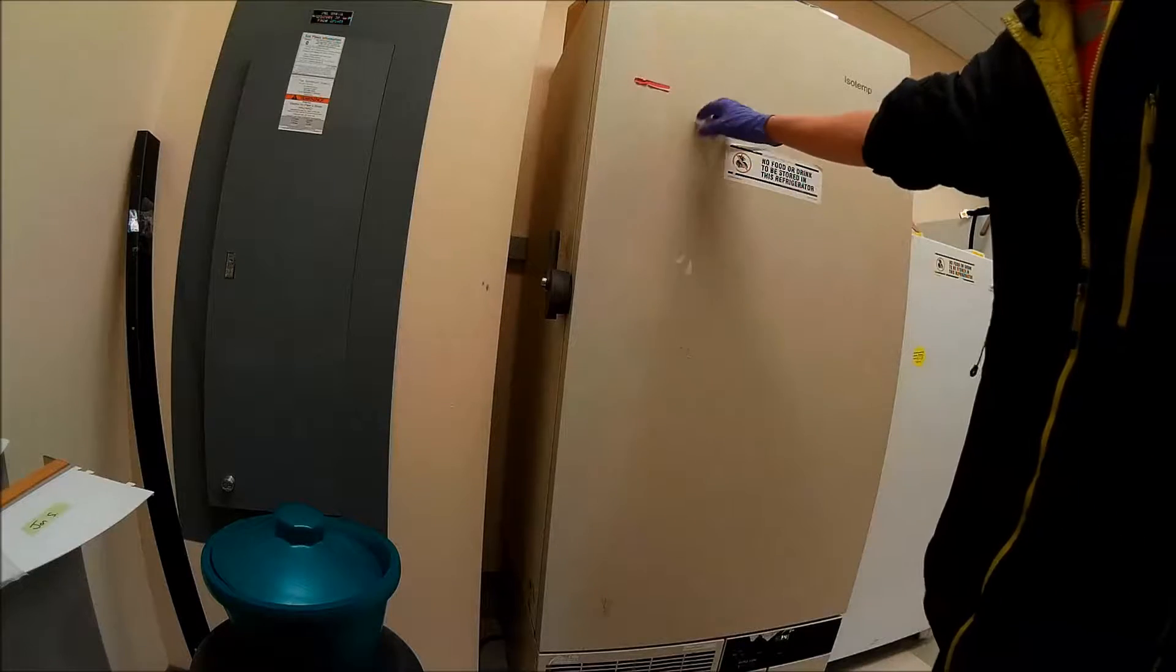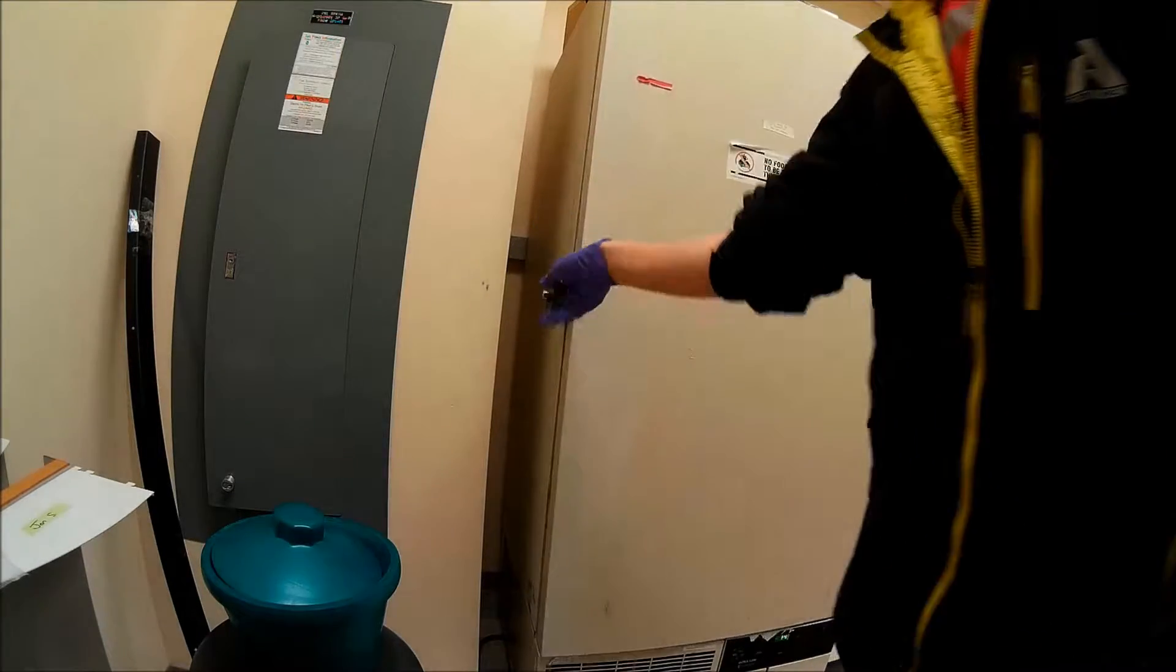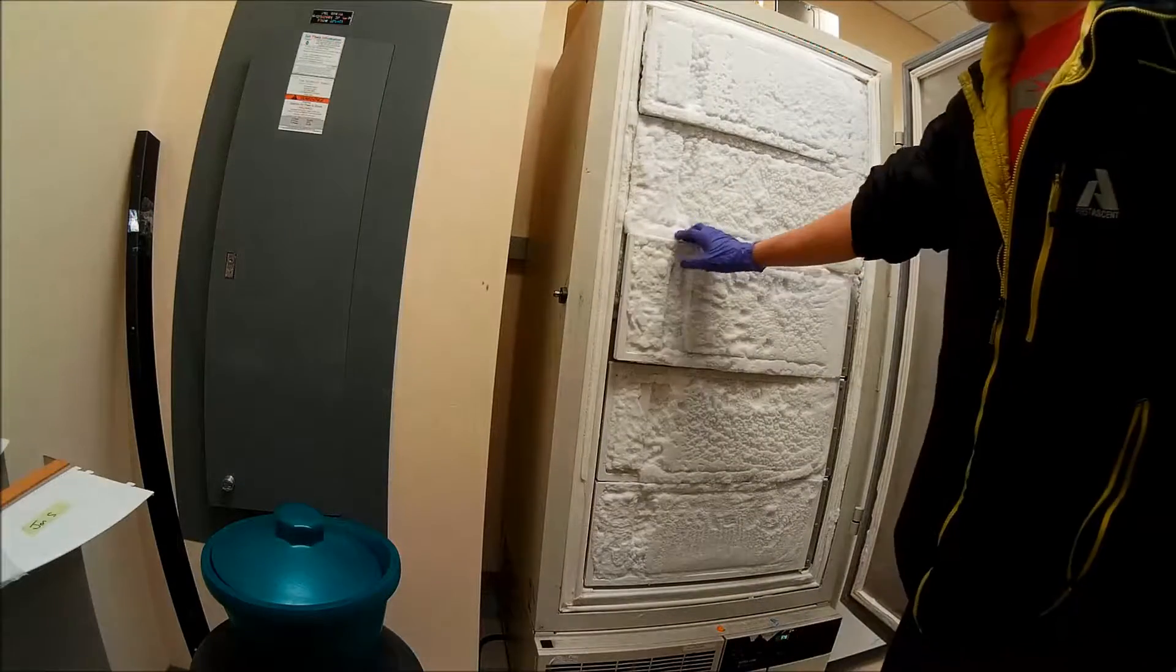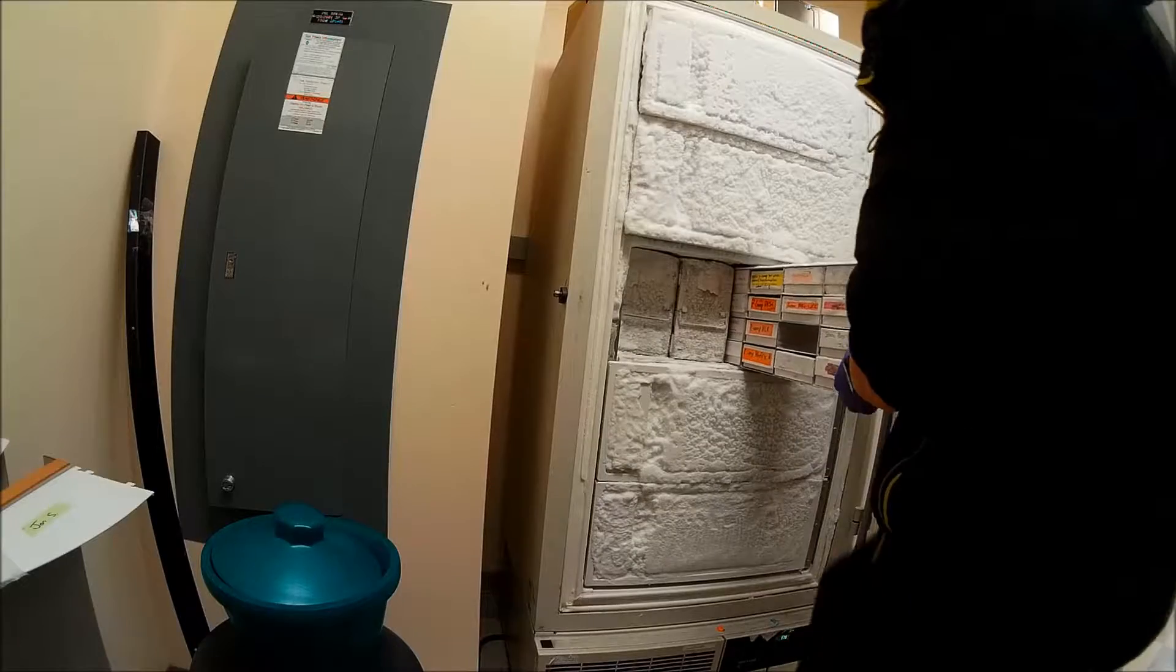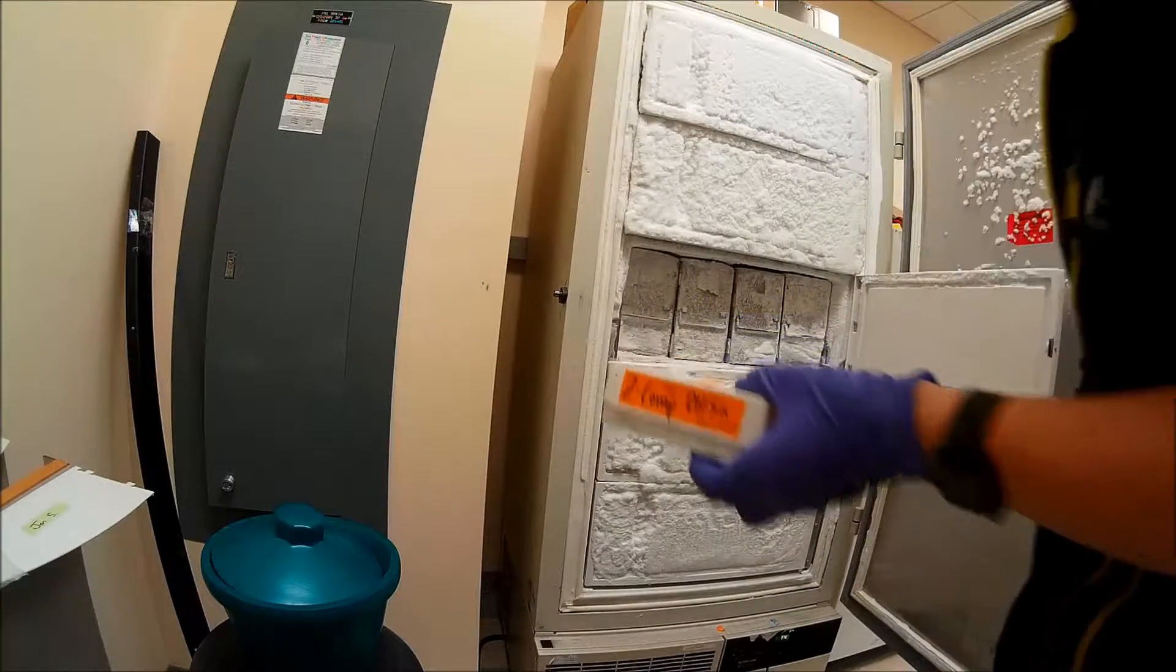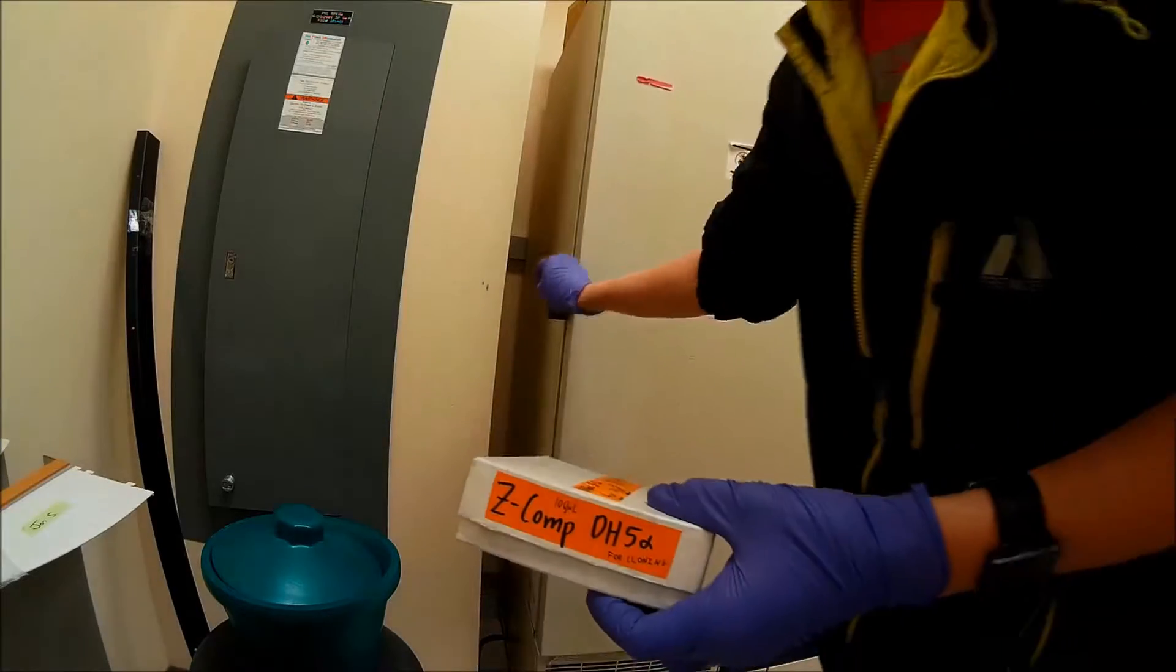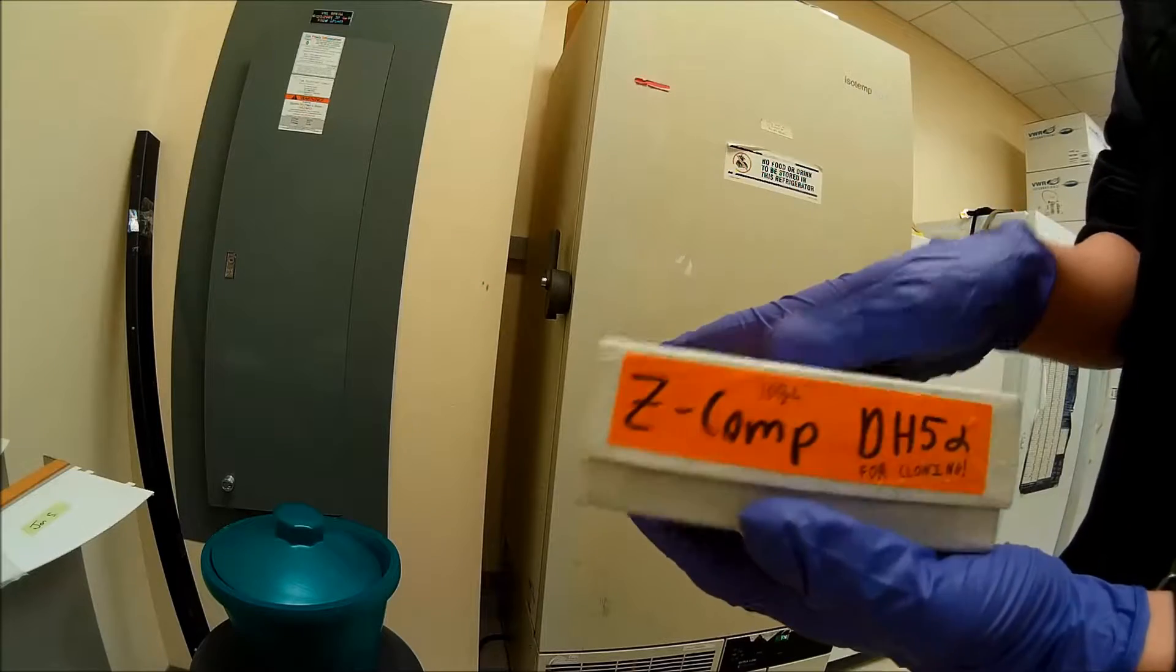In our lab, these are found in the large minus 80 upright freezer. We're here on the third shelf, in the third rack. And because I'm going to be transforming with ligation mixtures, I'm going to use these larger aliquots, 100 microliter aliquots. The box is labeled like that.